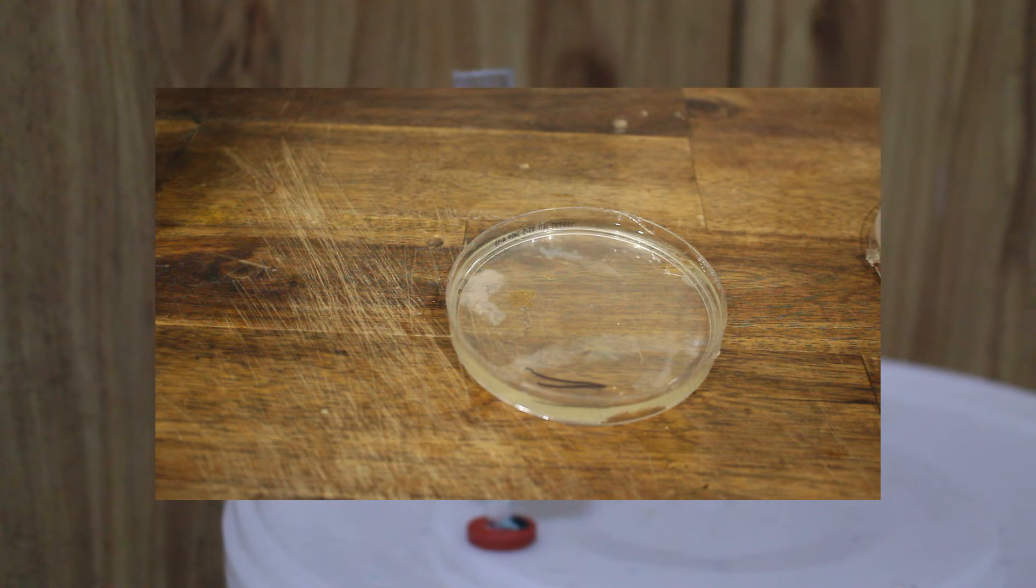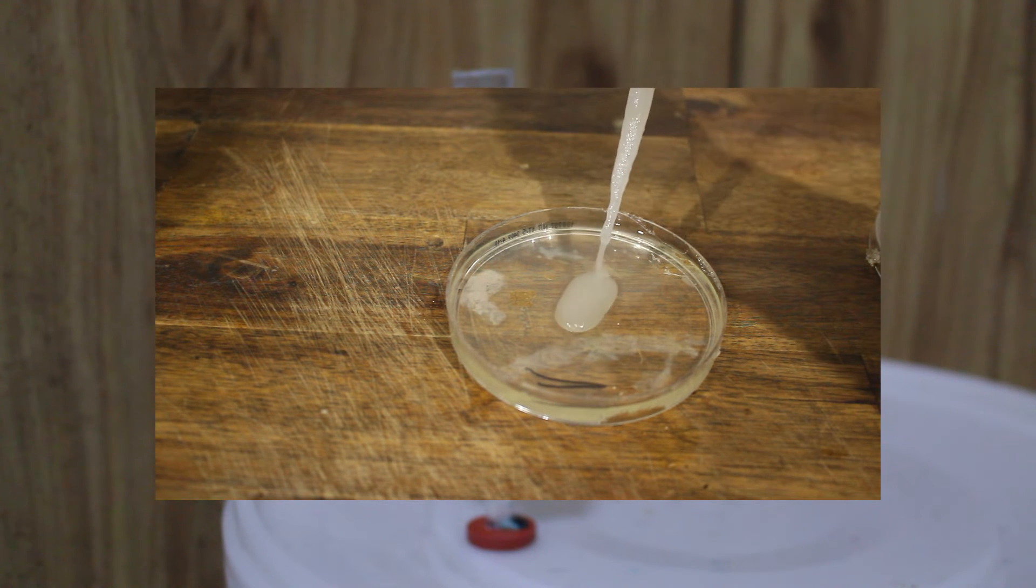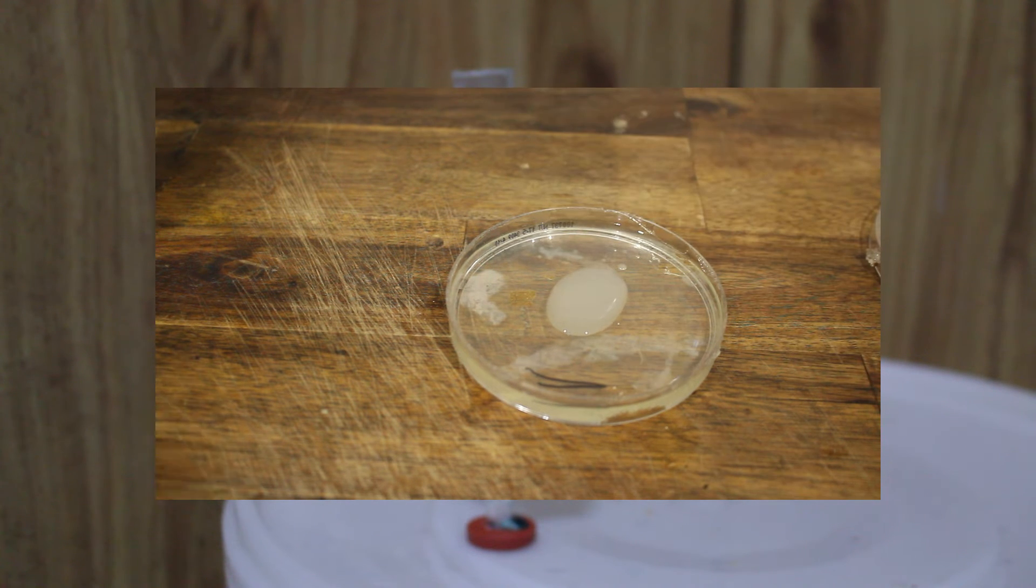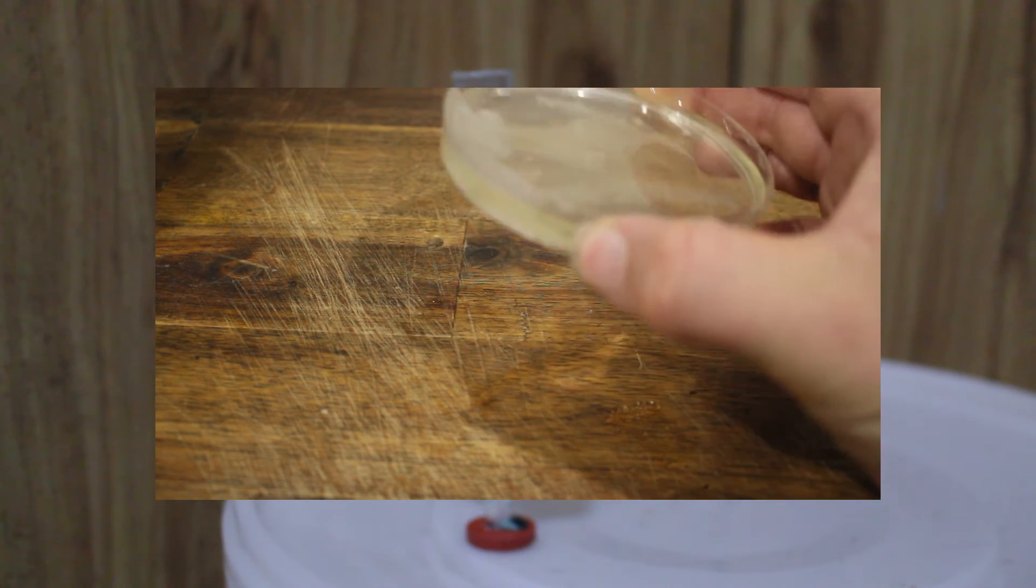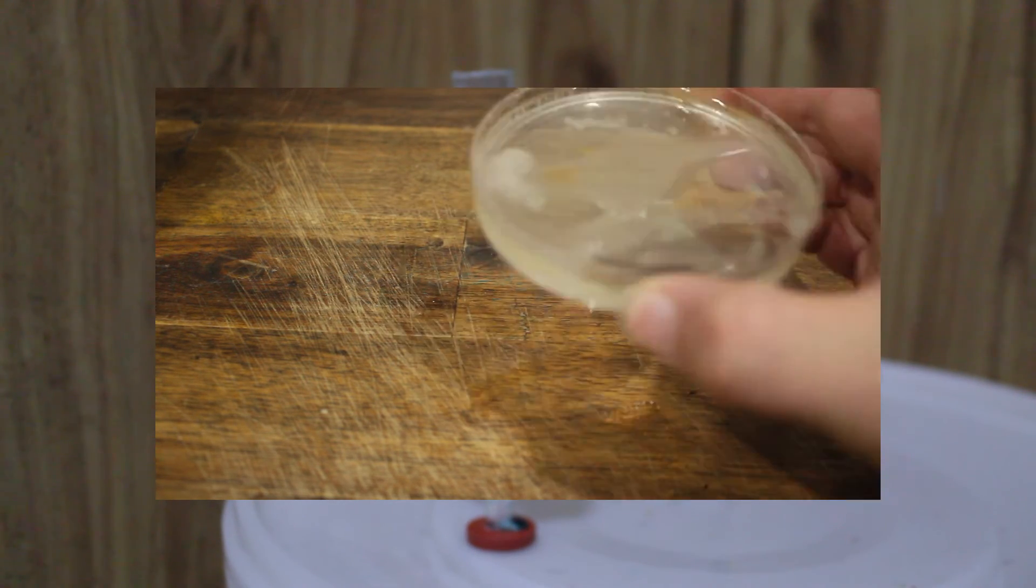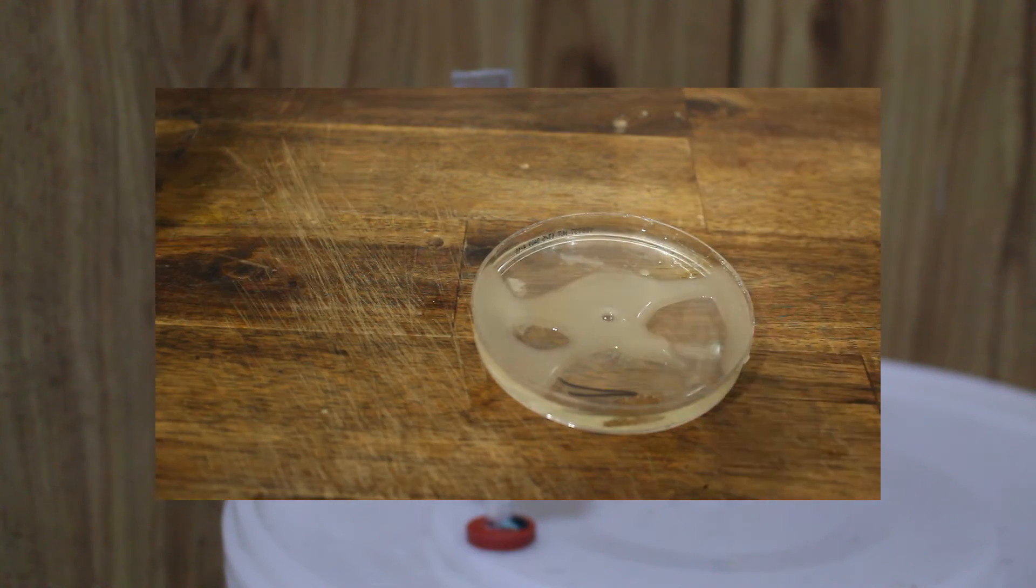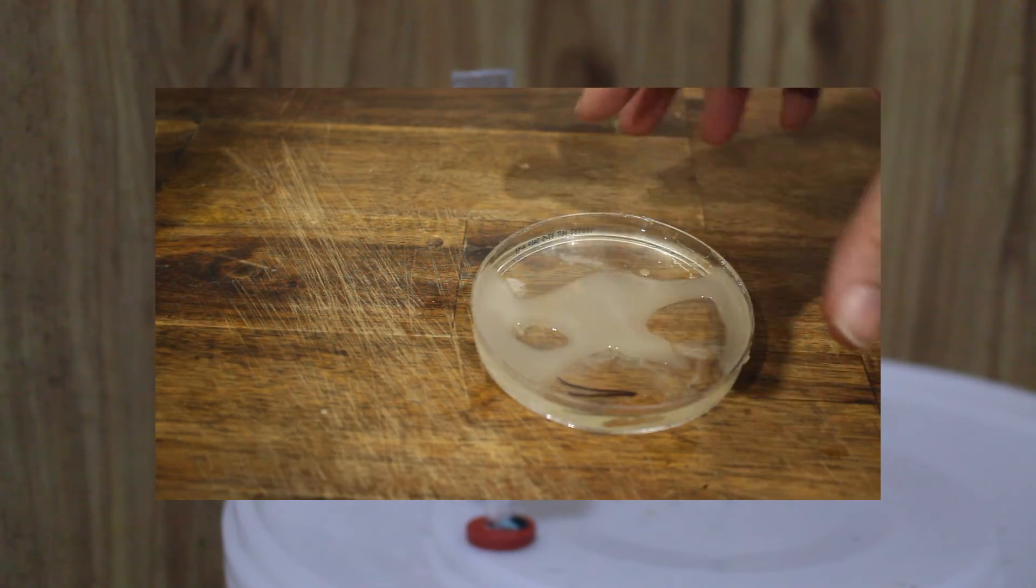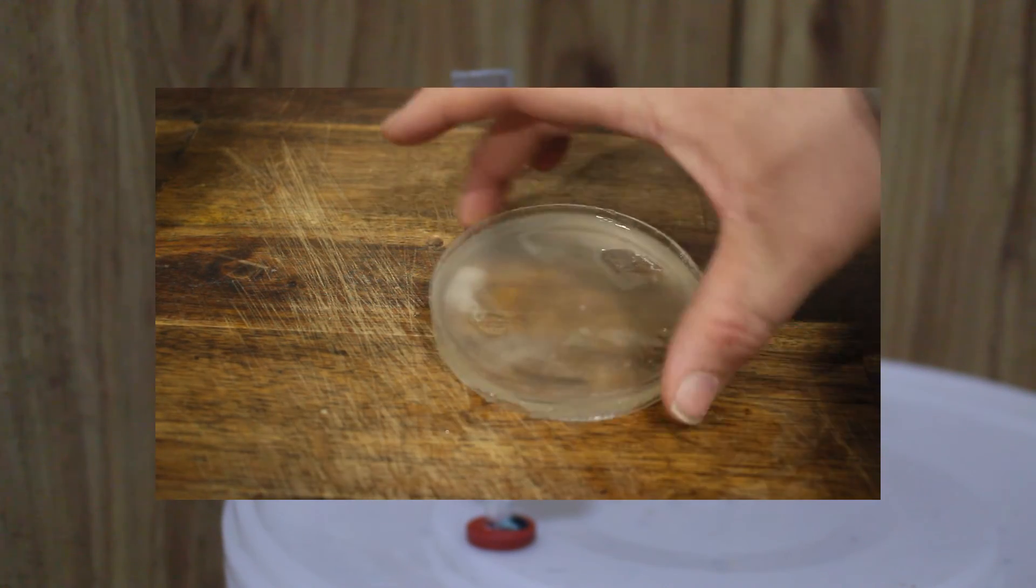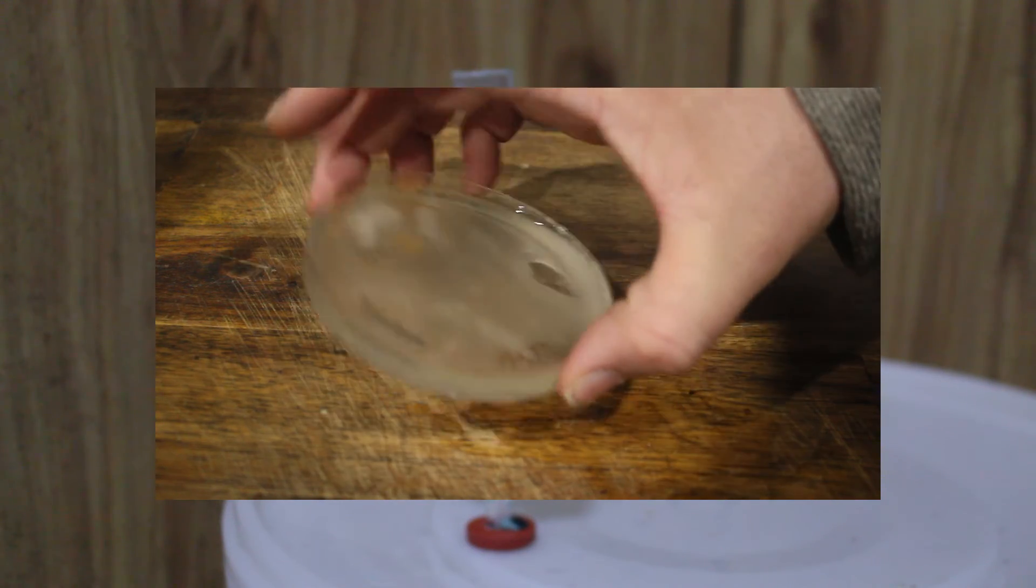You can, if you so choose, then culture a liquid yeast suspension which is what you want. What you do from that is you pour a small amount of the yeast solution over the plate. It can be a starter culture of your chosen yeast strain, a sample of the beer or any other means you have of obtaining your yeast. We won't go into creating a liquid inoculation for that purpose. How you get it is your business.